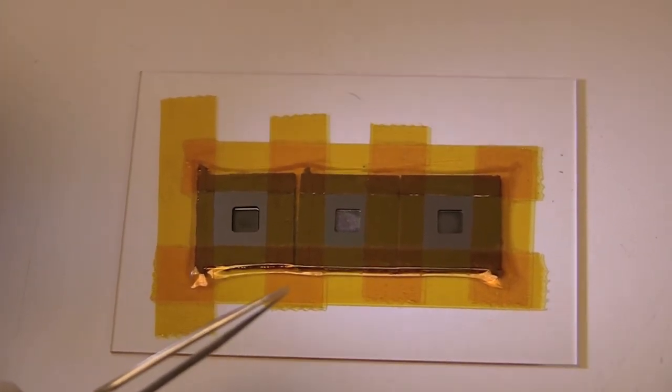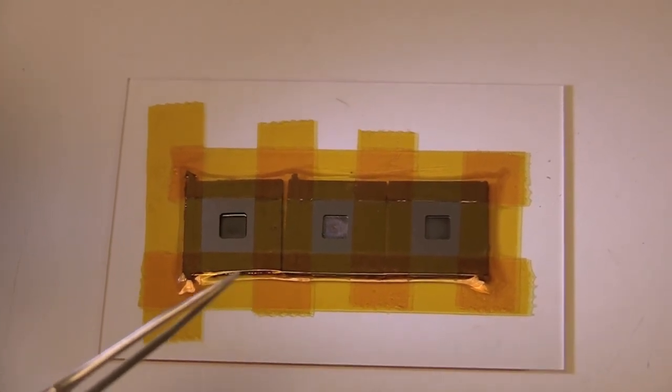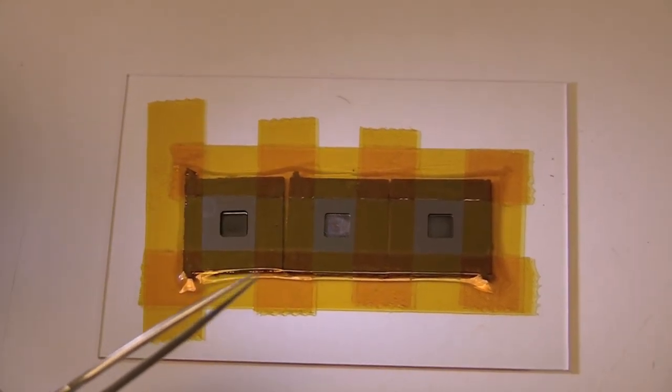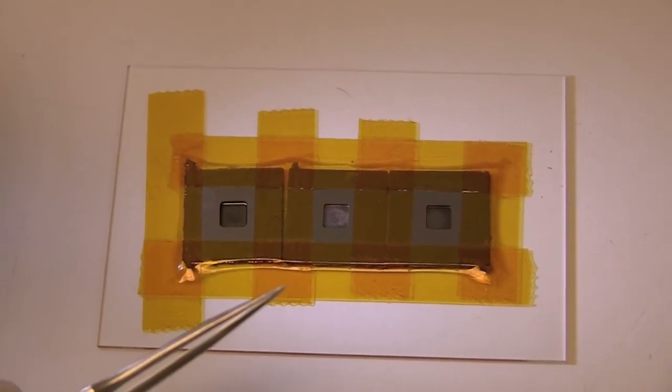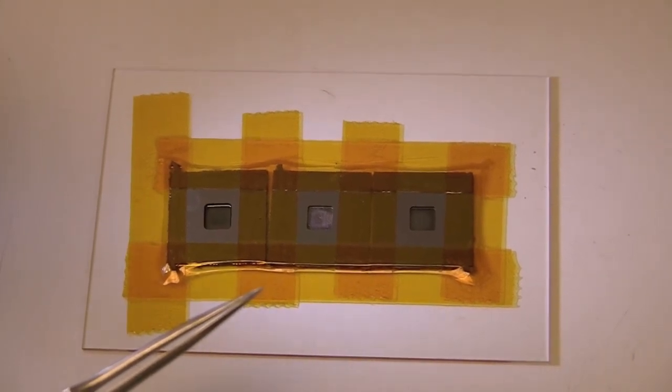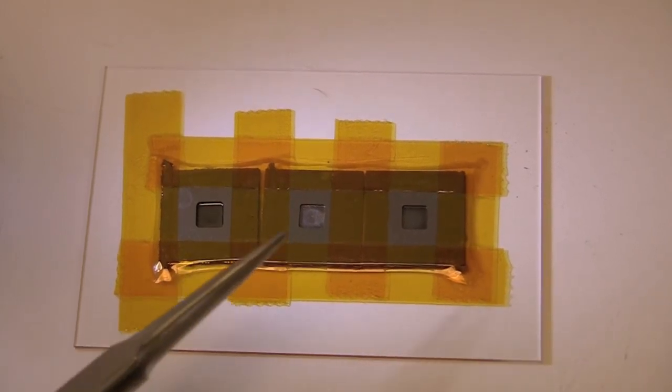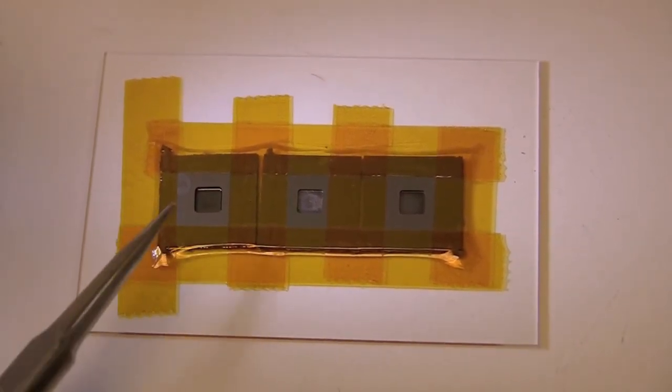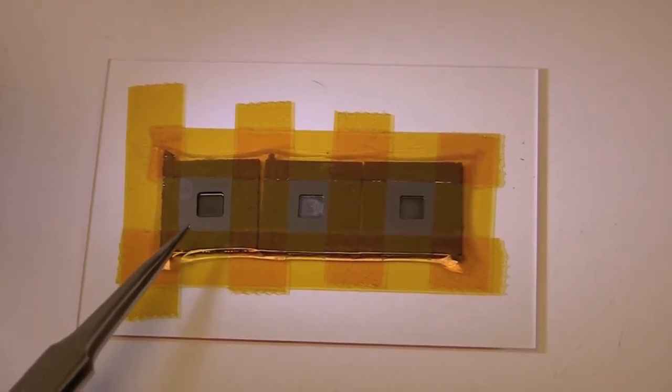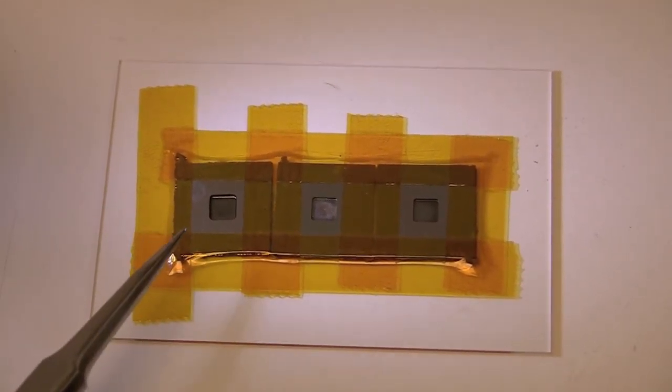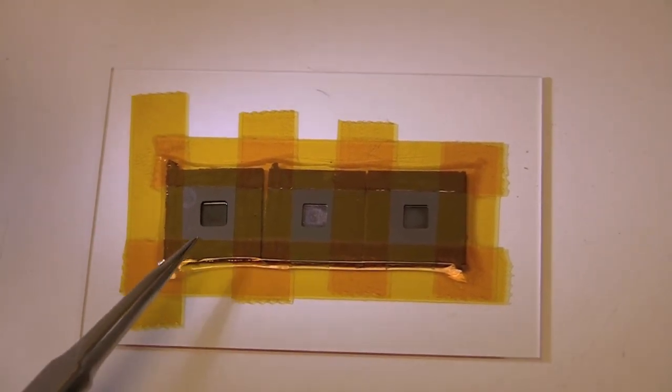So keep this in mind. For most people, it doesn't matter that much because many people in our facility just try to clear silicon for something else. But if you want to control the texture on your surface, bear in mind that you may want to etch slower for smoother surfaces. And also, a slower etch lets you control it better as well. You can catch a mistake like this before it happens. See if I had kept this going on a high etch, I would over-etch this guy before this one's finished. And that'd be bad because I'd lose the sample. If I etch slower, I can take slower steps and be more careful to avoid this kind of problem.